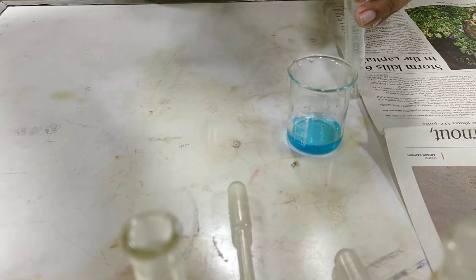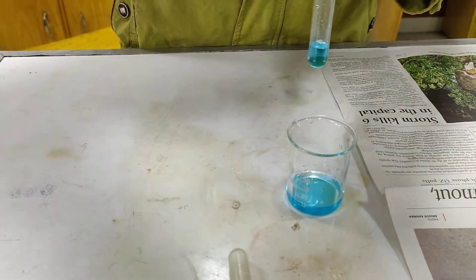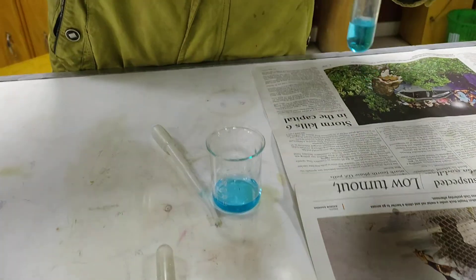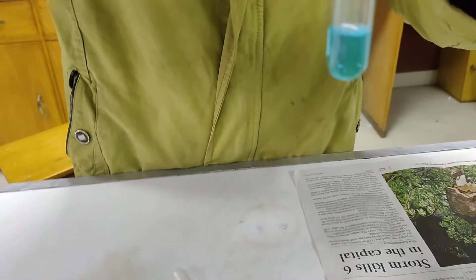Another 2 ml sample solution is being taken in the test tube. Into this test tube we are going to add 1 or 2 drops of potassium iodide solution. This will produce a white precipitate, but due to the presence of iodide it will form a brown coloration. This brown coloration is the presence of iodine, which indicates the presence of copper.